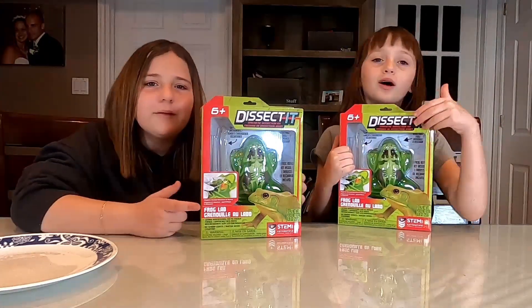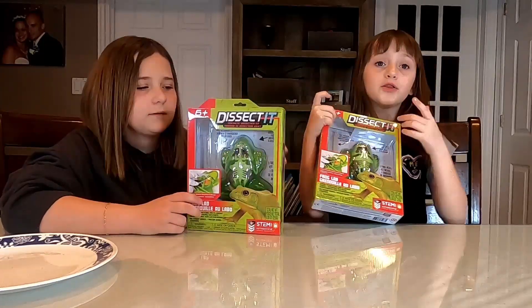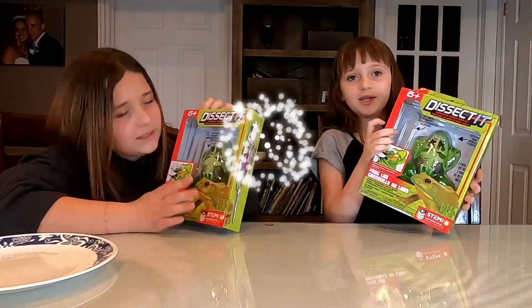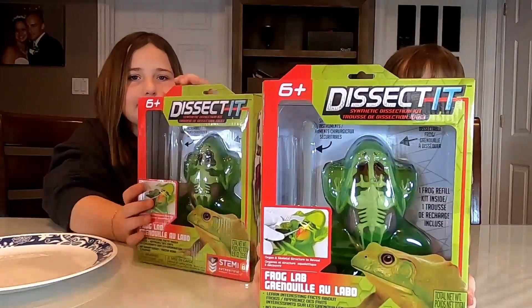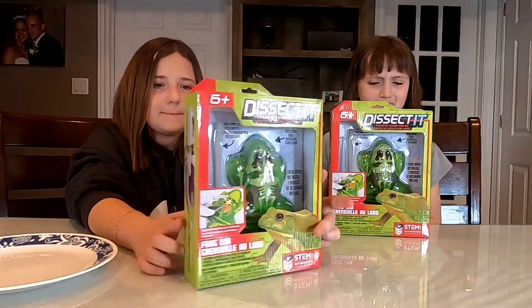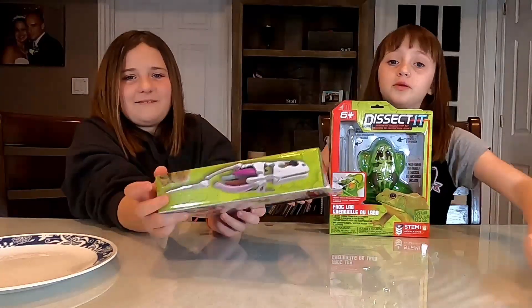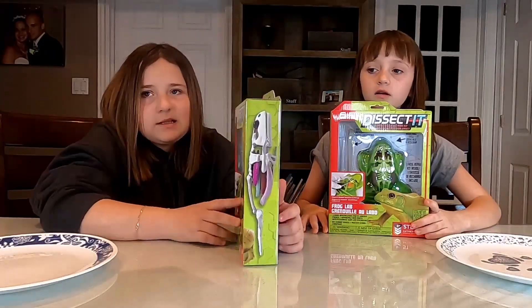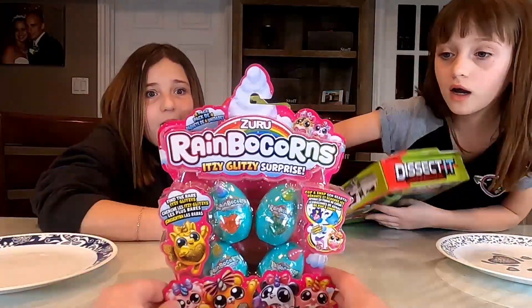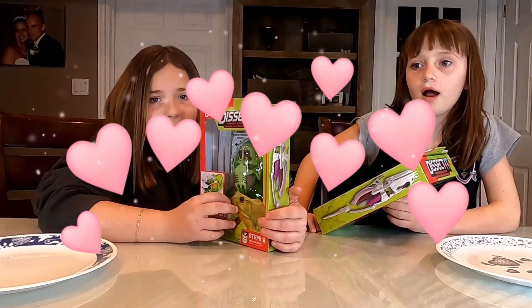What's up YouTube? Welcome back to another video. So today we are going to be doing a science experiment. Today's challenge is the girls have to dissect a frog, introducing all the body parts to you guys, and they have to try and put it back together. The first one to successfully do so without tearing their frog apart will be winning a prize of Rainbocorns. So without further ado, let's get started.